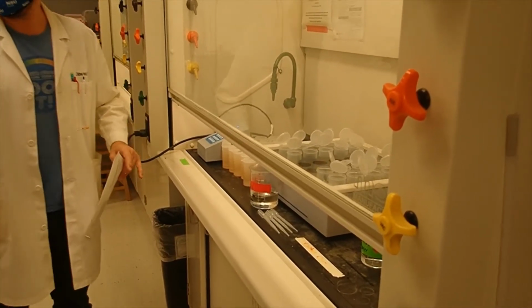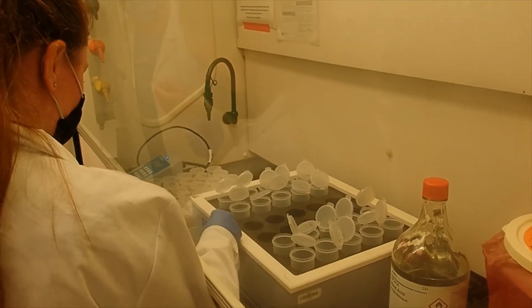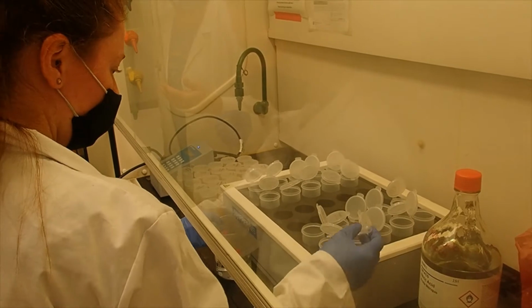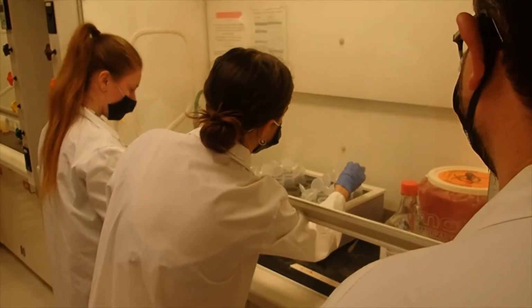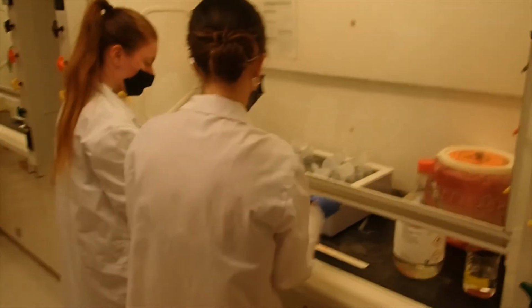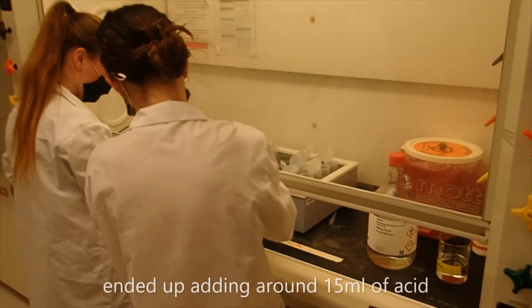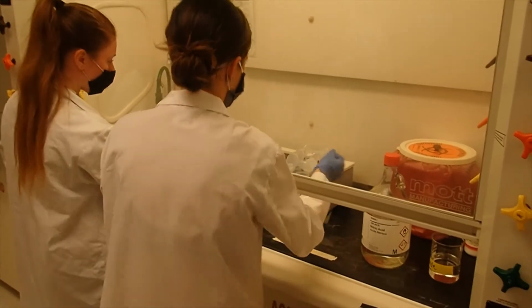And then you two can do the first round. So you just kind of got to count it up. So that's 3 and then you need 2 more for that one. At this point we're going to be up to about 15 milliliters of nitric acid. And we usually don't have to add more than 20.